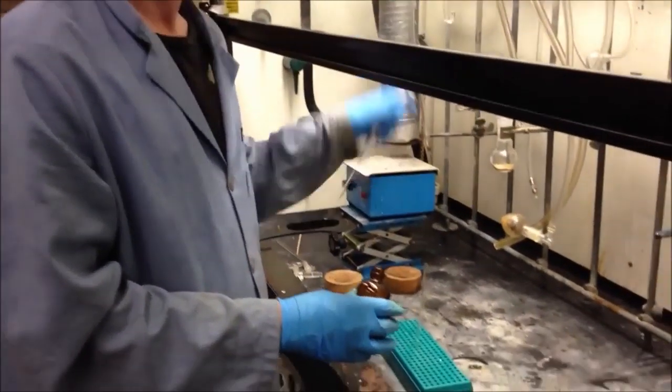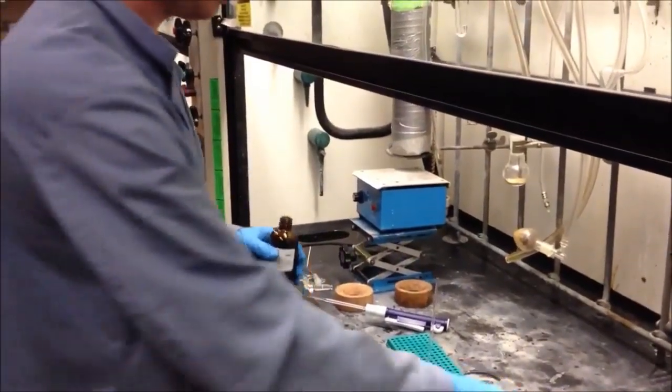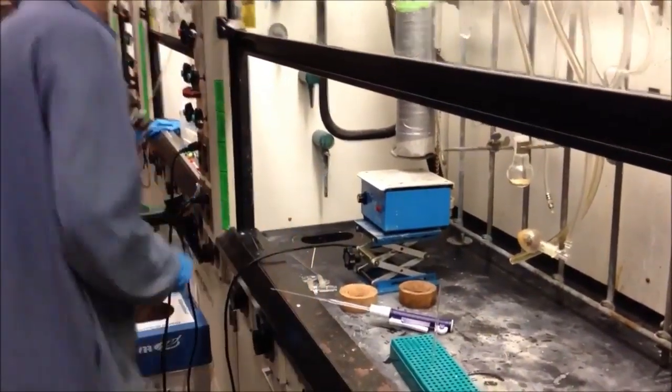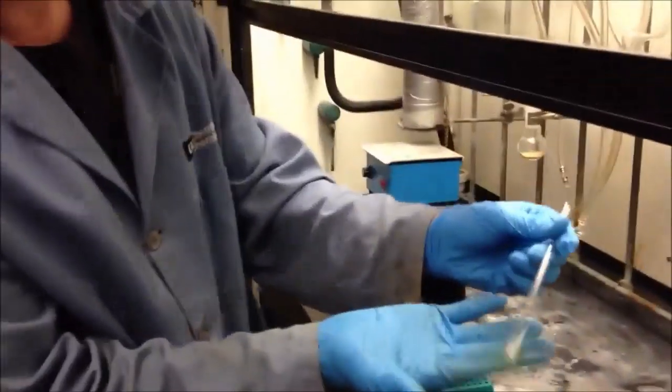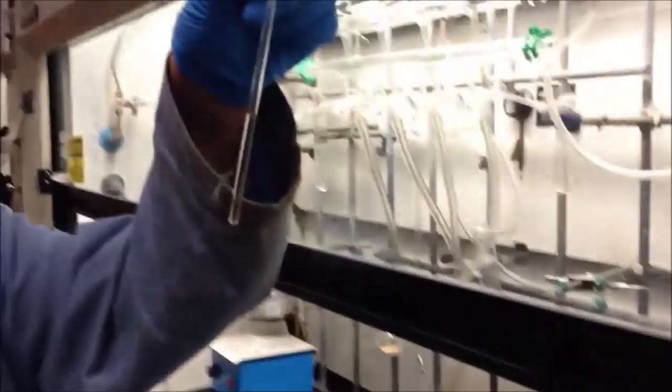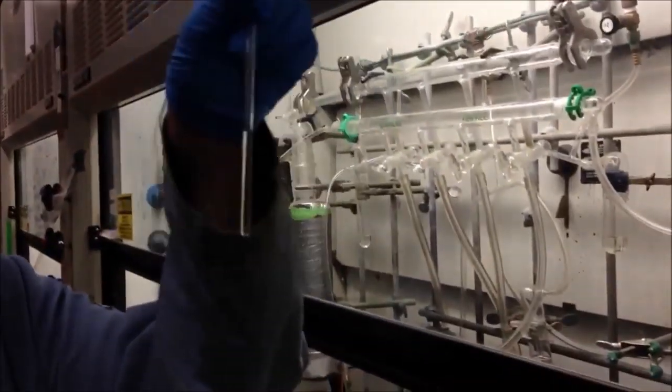We'll add the solvent. In this case, deuterated chloroform. Shake it up a bit. And there's our sample. Now, we'll be back in a few minutes to check on the results.